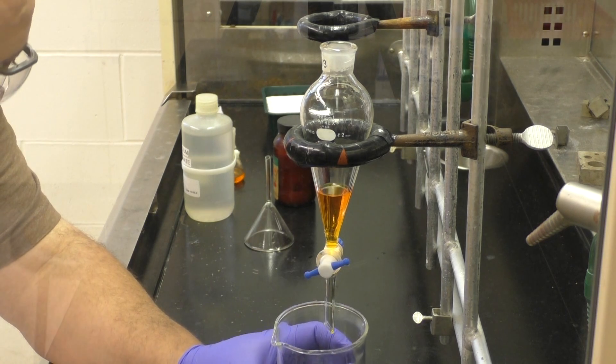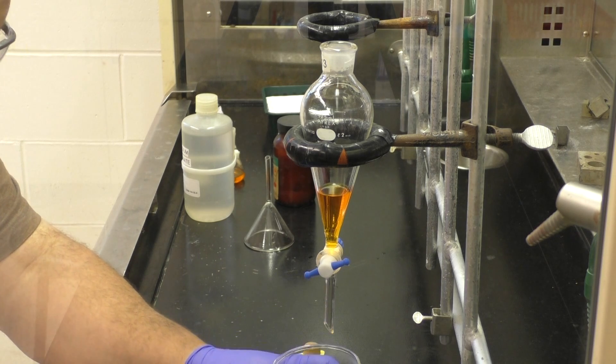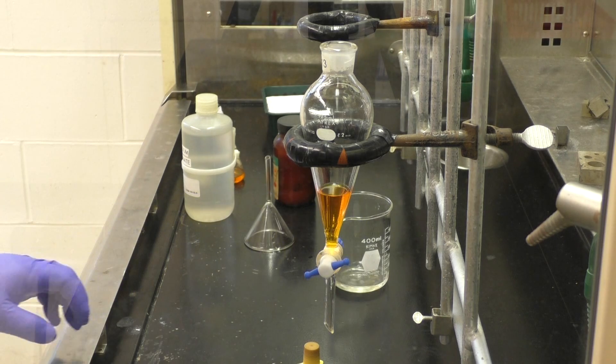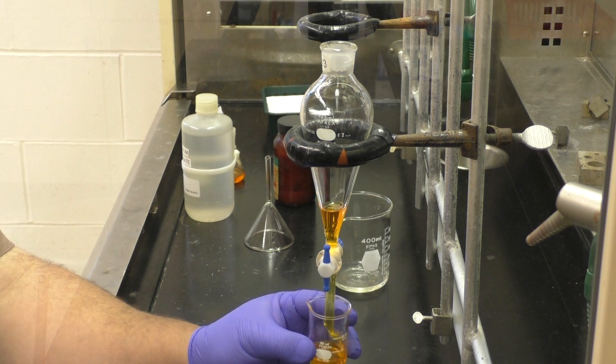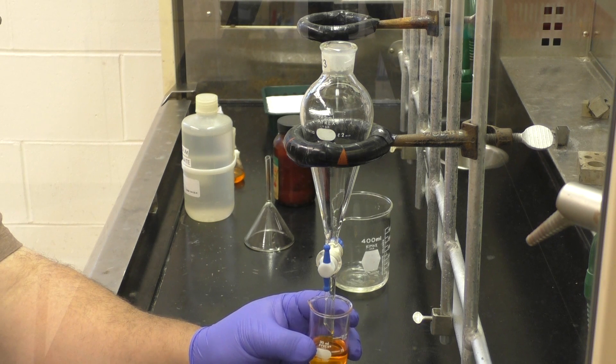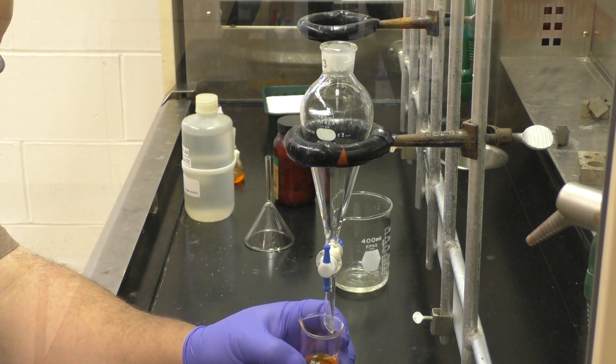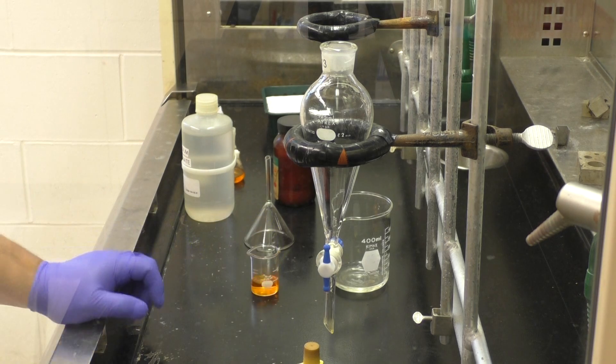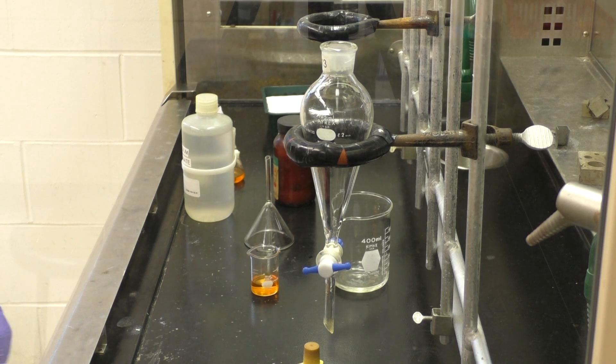In this case with the ether, our solvent on top, we're going to run off all the aqueous phase, and a little bit of the organic, knowing that what we've left behind is only organic. None of the water layer. And that's our more pure organic compound. Now again, for what this sort of imaginary procedure is doing, once we did this wash, we would take our organic layer, and we're going to wash it again.